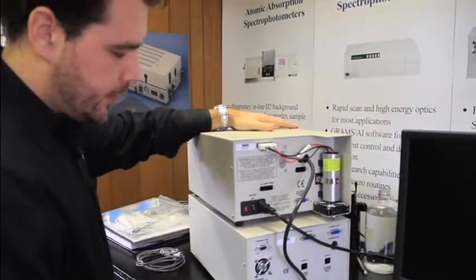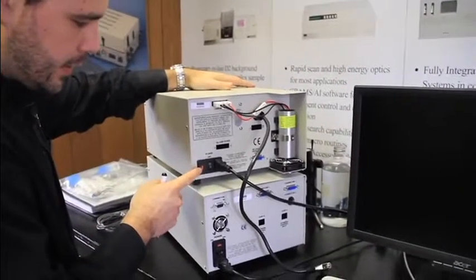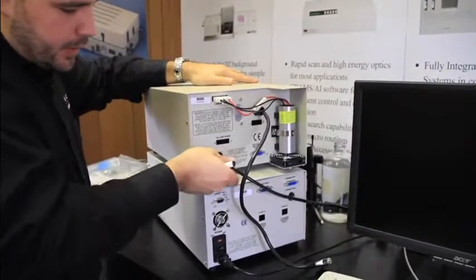Before turning on the instrument and plugging them in, ensure that the voltage on the fuses are set to the appropriate voltage. Connect the power plugs into the socket.